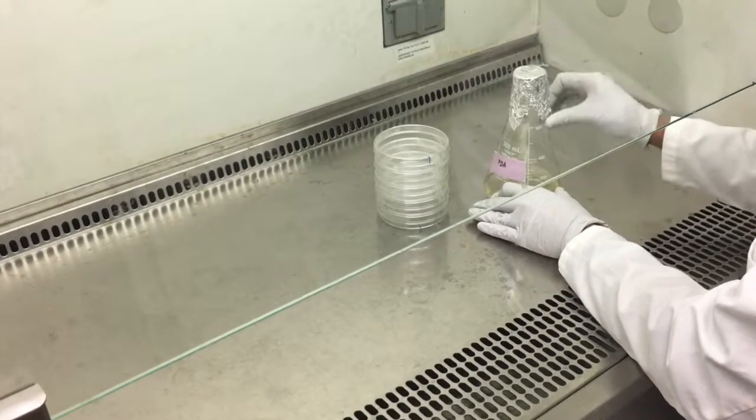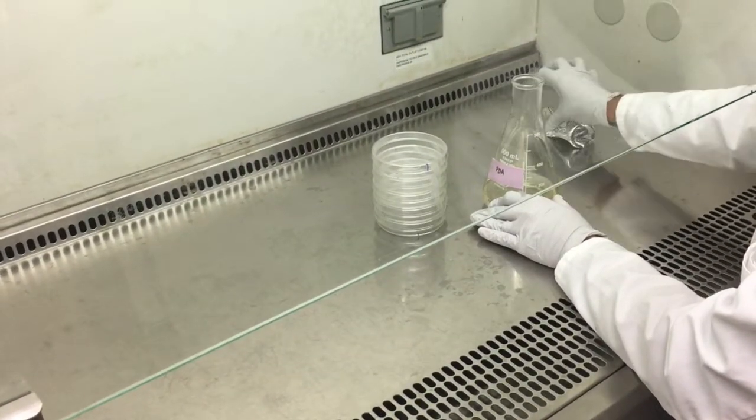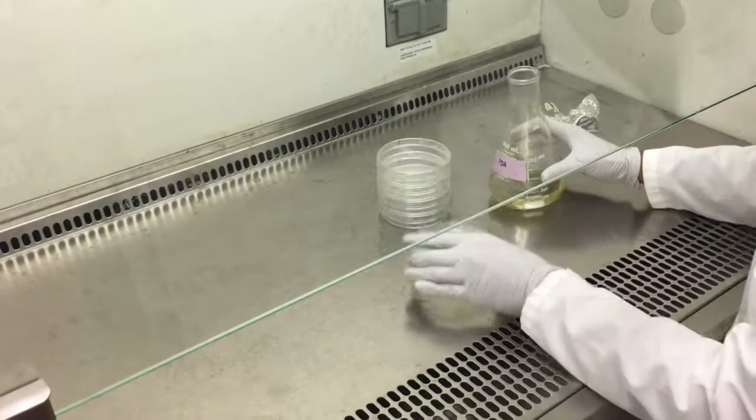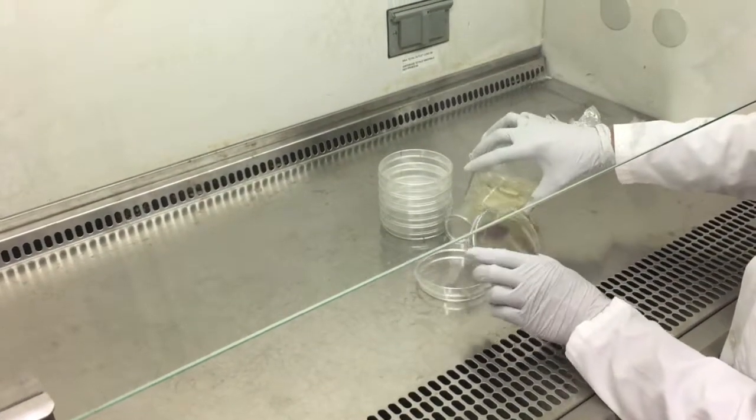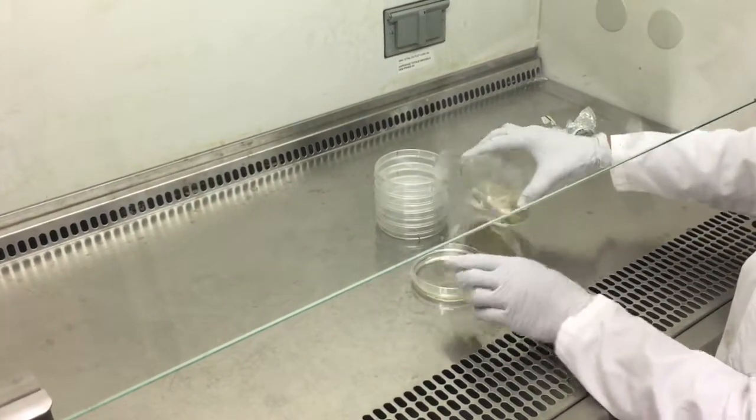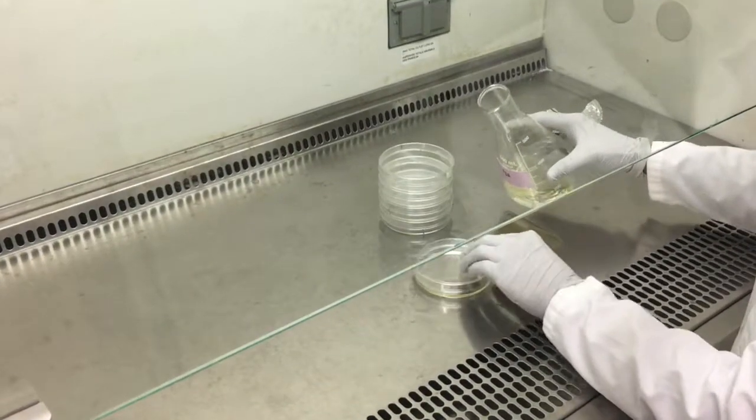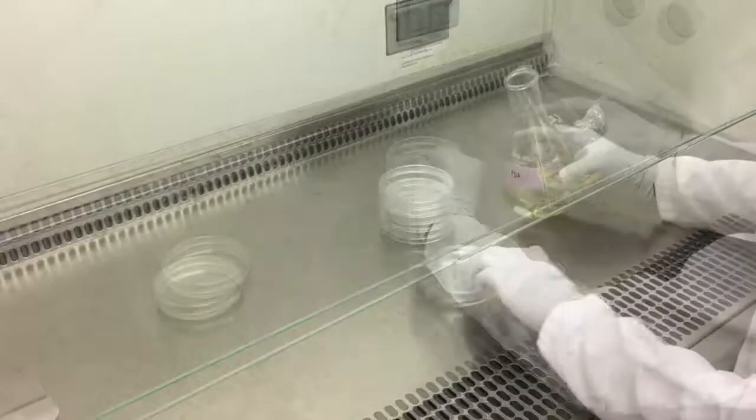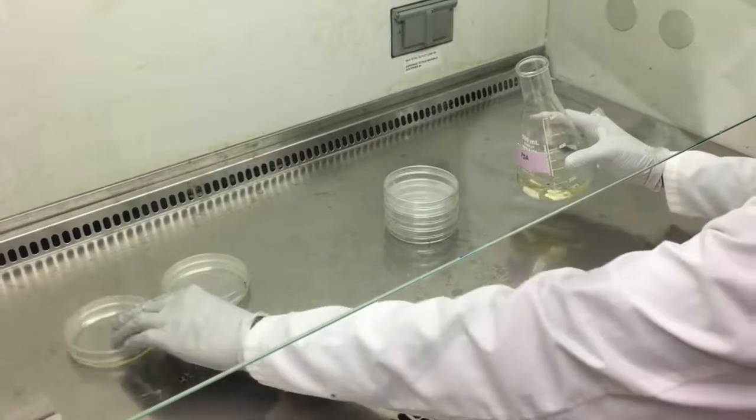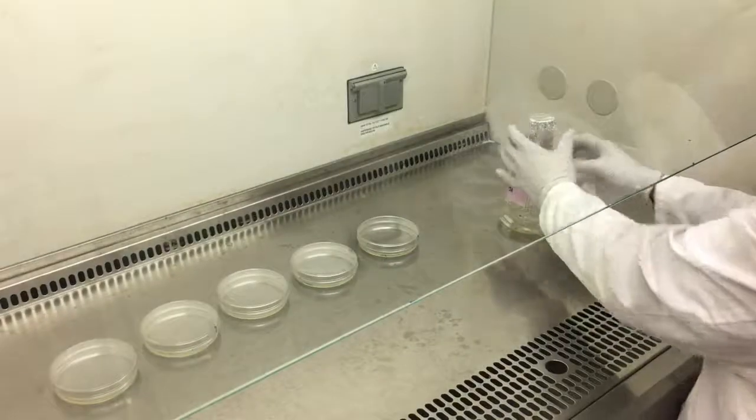Place all petri dishes and media into the cabinet so you are not constantly moving in and out. Even though you are within the cabinet, avoid leaving media or dishes uncovered for any length of time as changes to the airflow will put them at risk of contamination. Set the plates aside to solidify within the cabinet and place them into the original bag after labeling for storage.